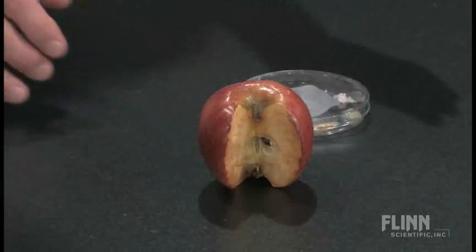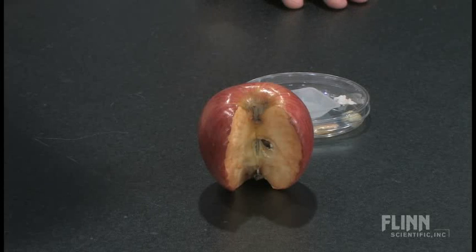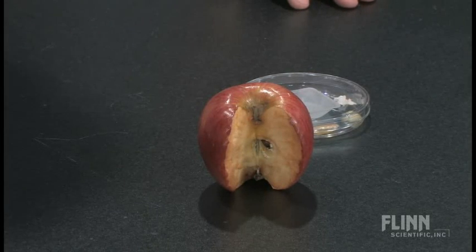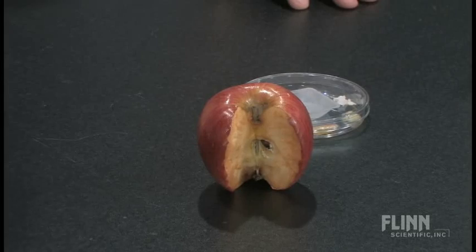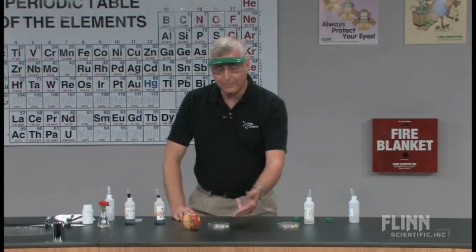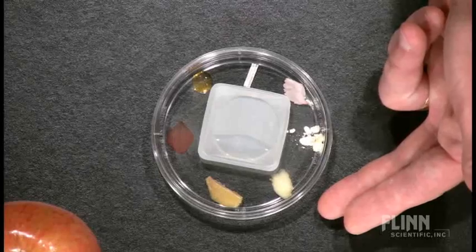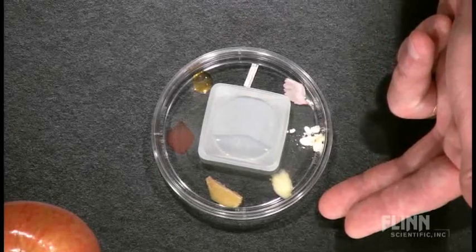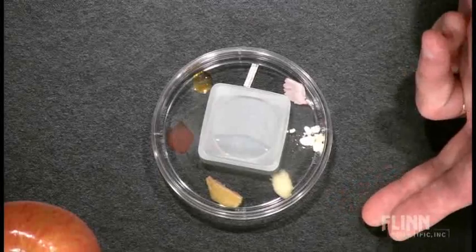When we start off with the apple — this apple was cut earlier — we notice the typical darkening that we would see on the surface of the apple. It's not very appetizing. But if we take a look at the apple that is in our dish here, we see that that apple is still nice, pretty, and it has not oxidized.